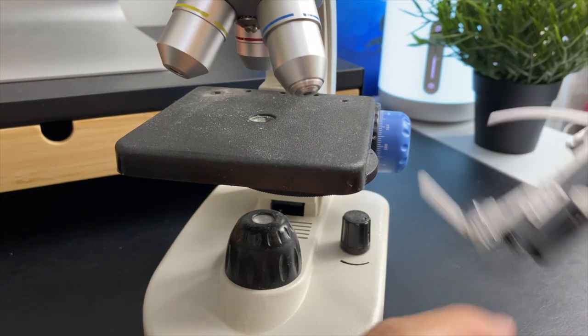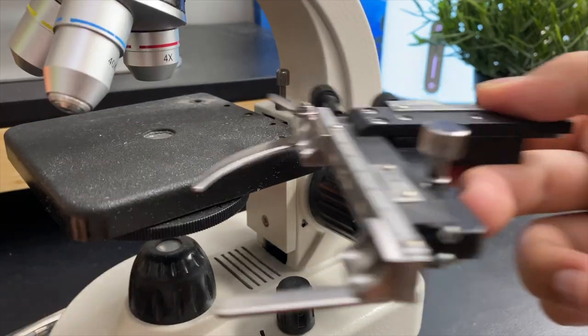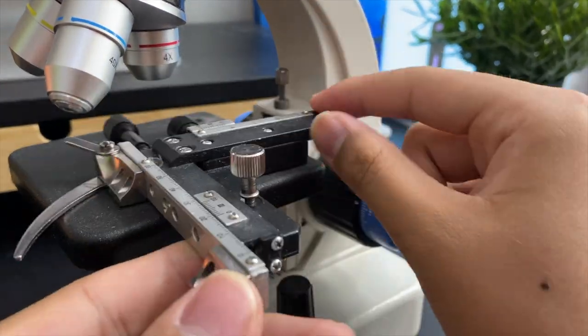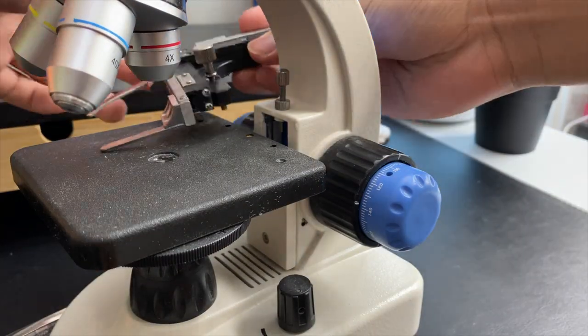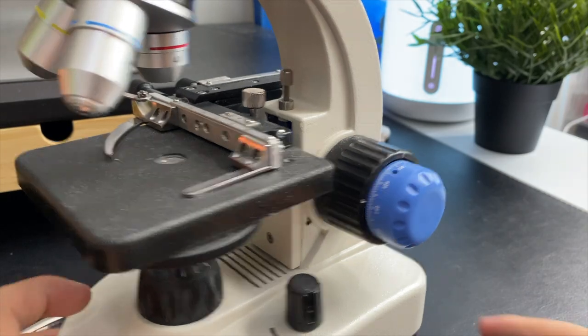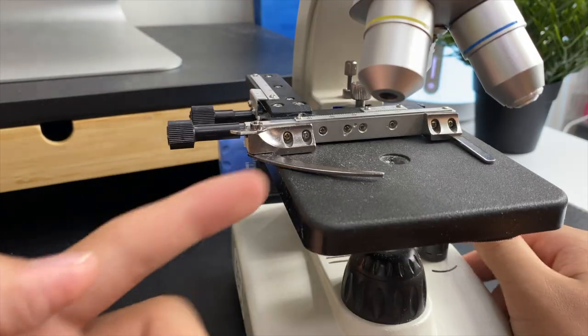Now, to put on this one. First, we want to align the screws to the screws here. It's done, actually.